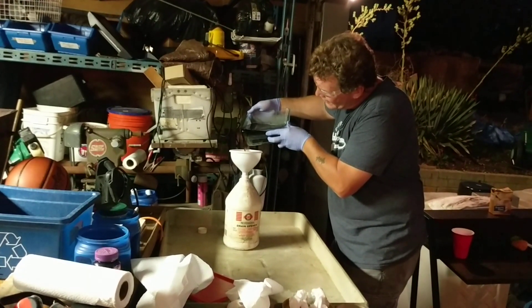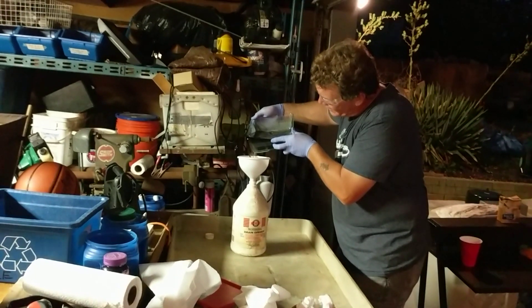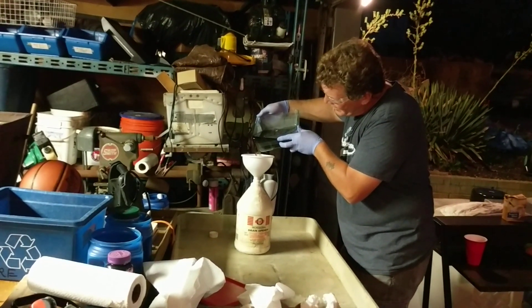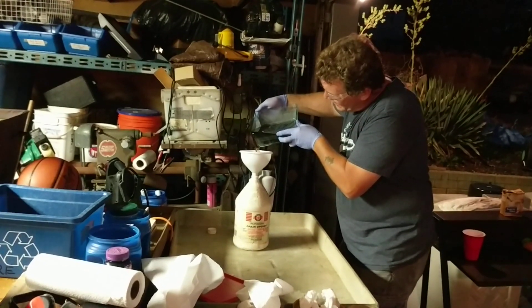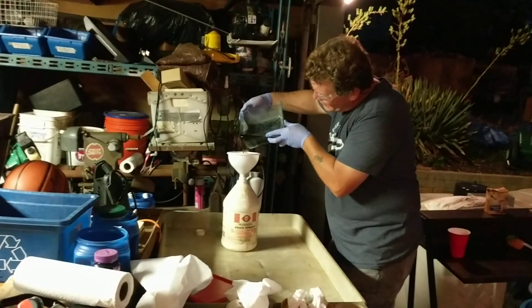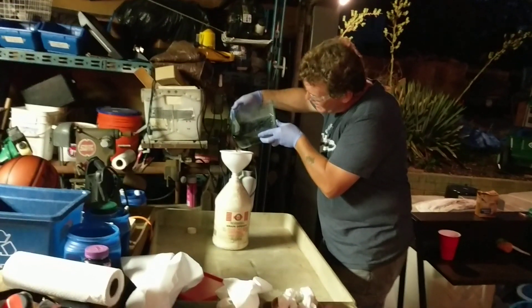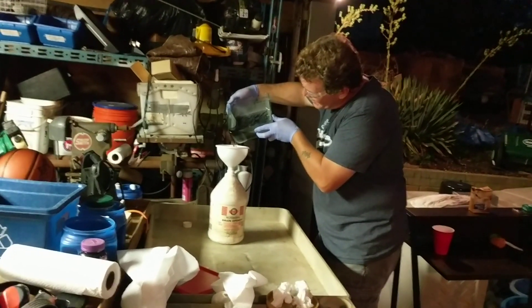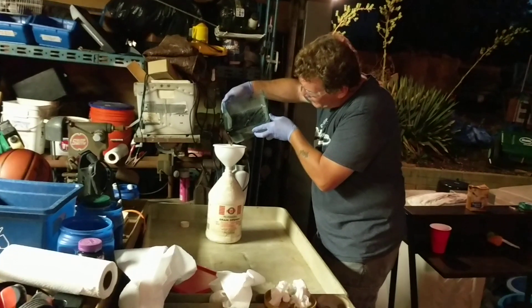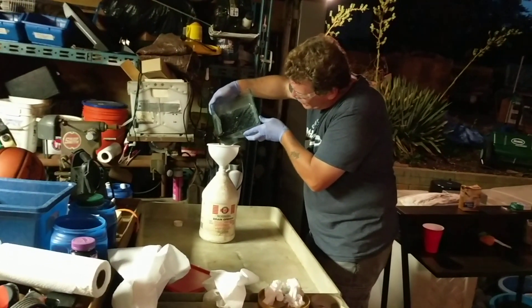It's still a little dark here, so there's still a little bit of gold in it. Now I'm getting bit by a fly — not the only one. Joe's on the camera again — hi guys, how you doing? I don't know if you can see from there, but all my slime is going into the corner.